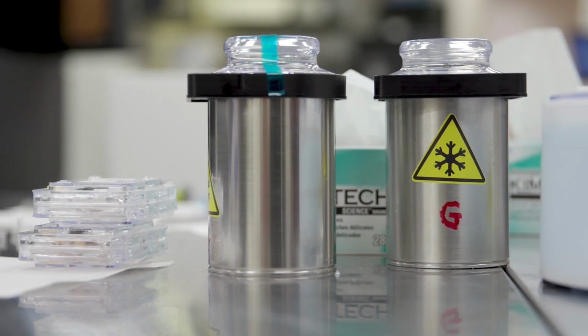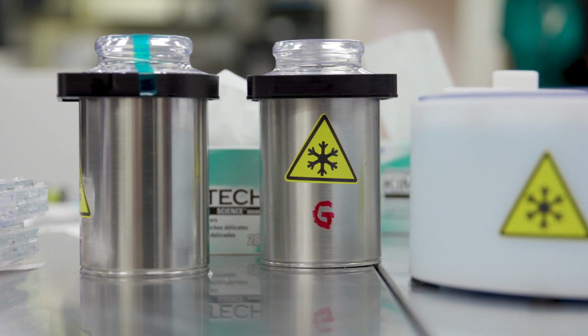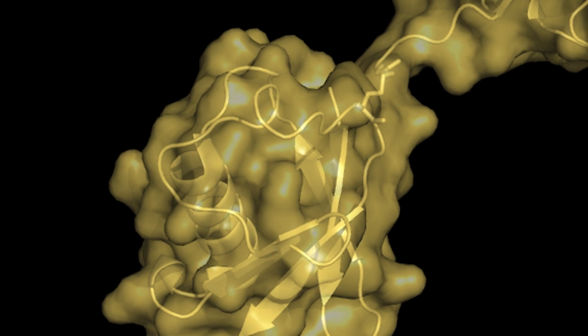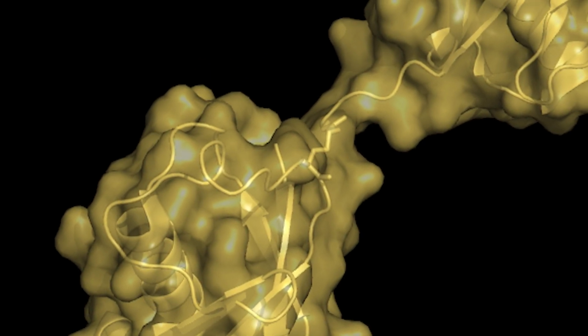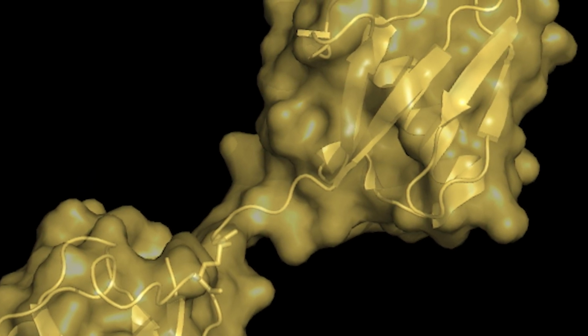The ability of science to make new advances is really only as good as its tools are to do precision types of measurements. And that is why technology is such a driving force, and why, as technology continues to improve, we keep seeing more significant scientific advancements.